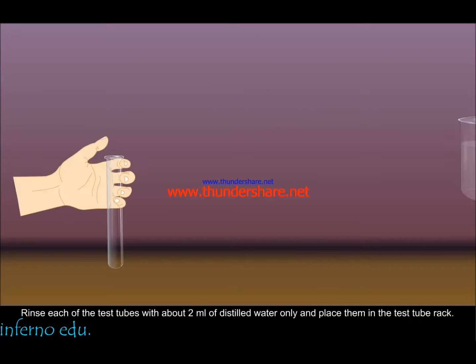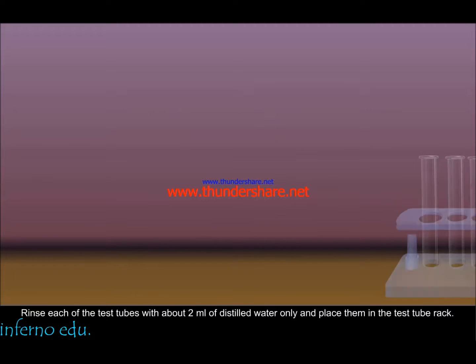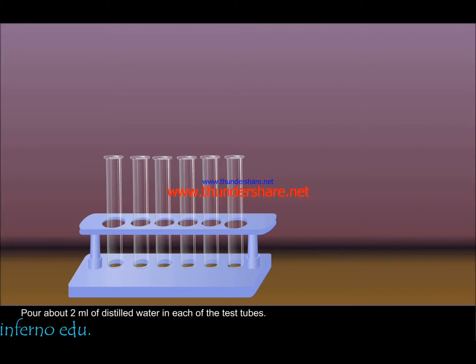Procedure. Rinse each of the test tubes with about 2 ml of distilled water only and place them in the test tube rack. Pour about 2 ml of distilled water in each of the test tubes.